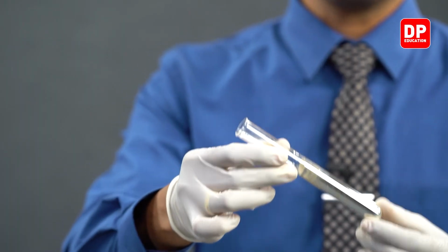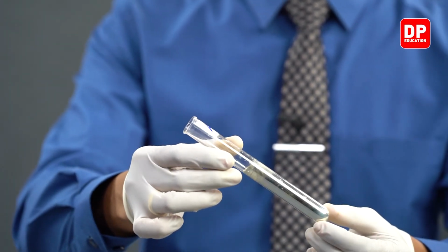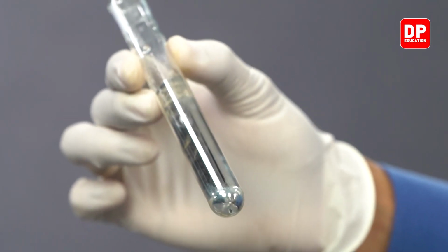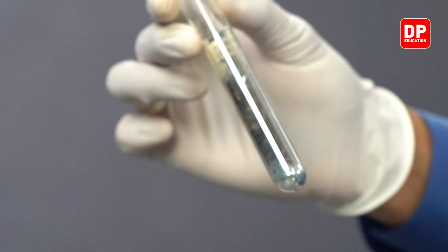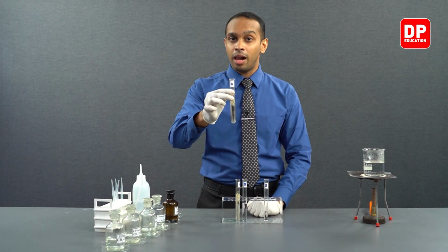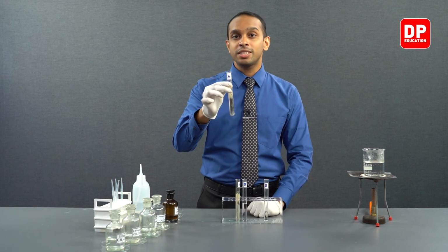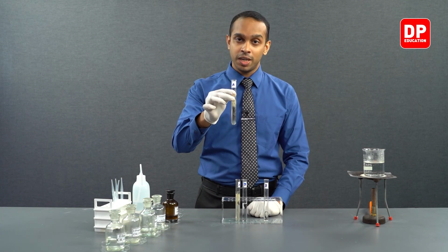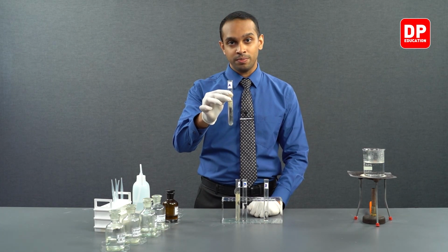Now, you can very clearly see how the interior walls of the test tube A is coated with silver. Again, as I mentioned before, when we carry out the silver mirror test with the help of Tollens reagent, the silver(I) ions, Ag+, in the Tollens reagent get converted into solid silver.